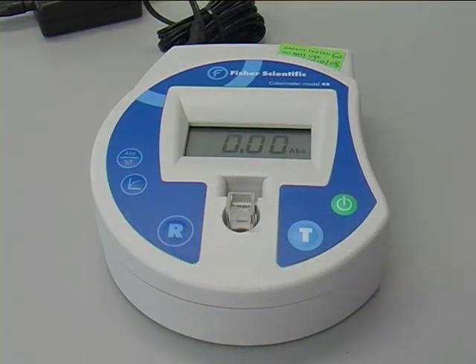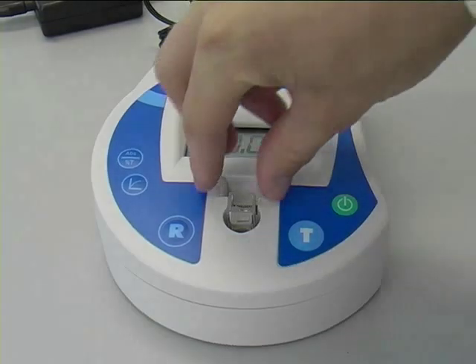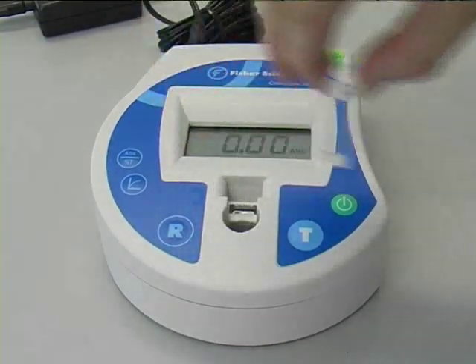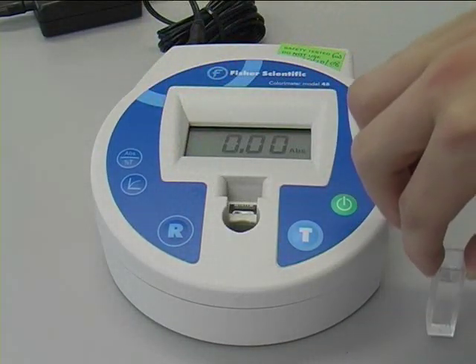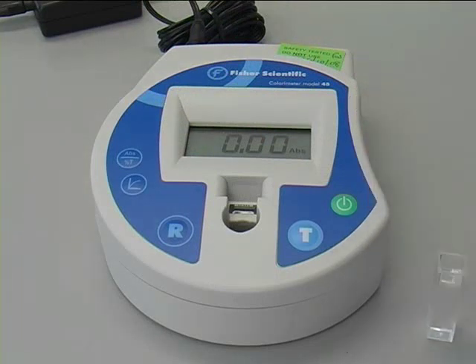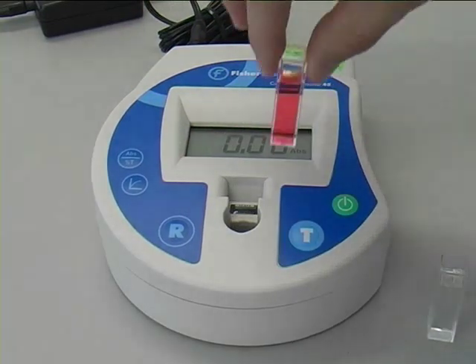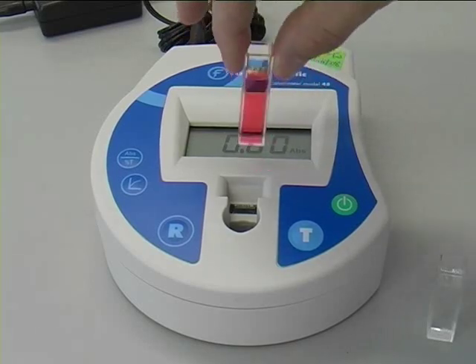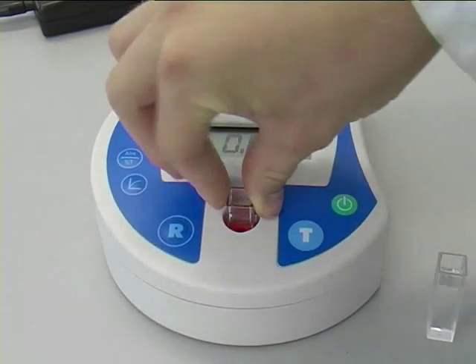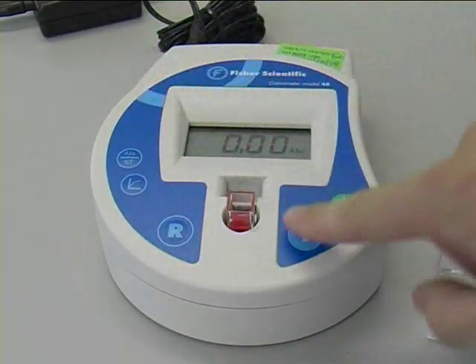Remove the reference and insert the sample cuvette. Press the T button and the absorbance reading of the sample for that filter will be displayed.